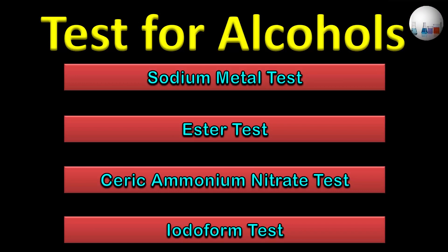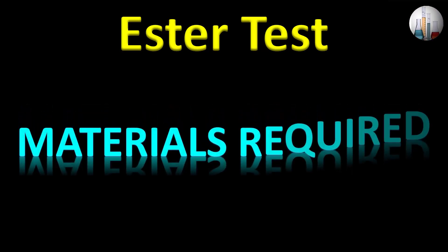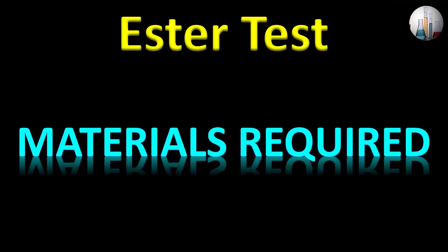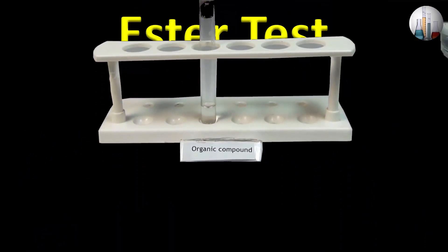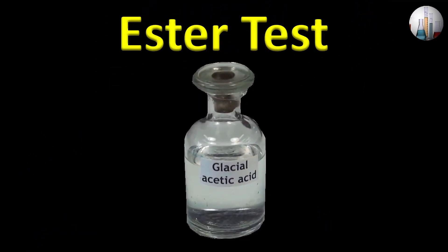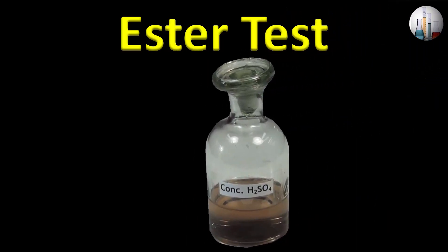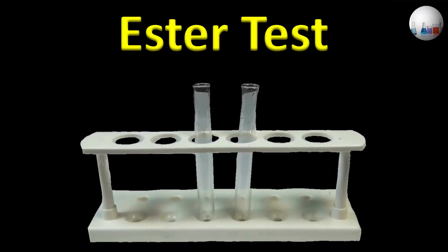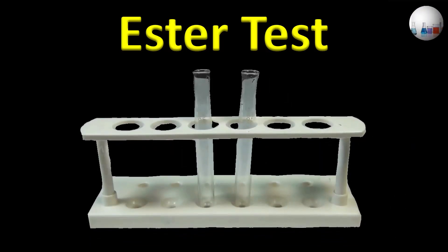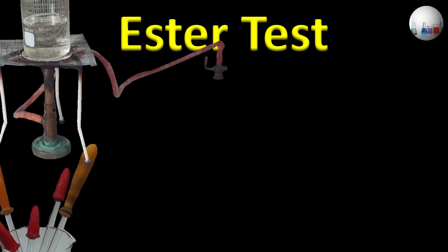The next test is the ester test. Materials required: organic compound, glacial acetic acid, concentrated sulphuric acid, a beaker containing cold water, test tubes, droppers, and water bath.